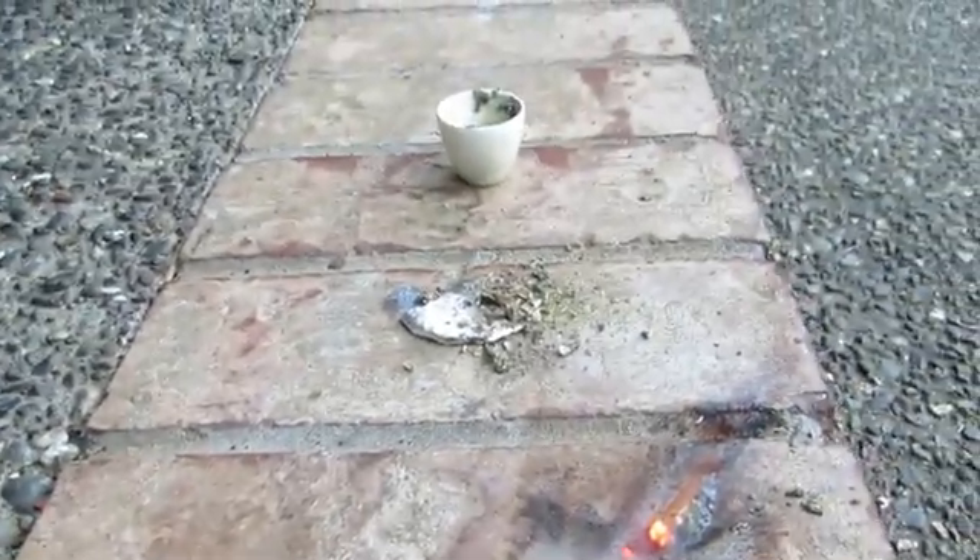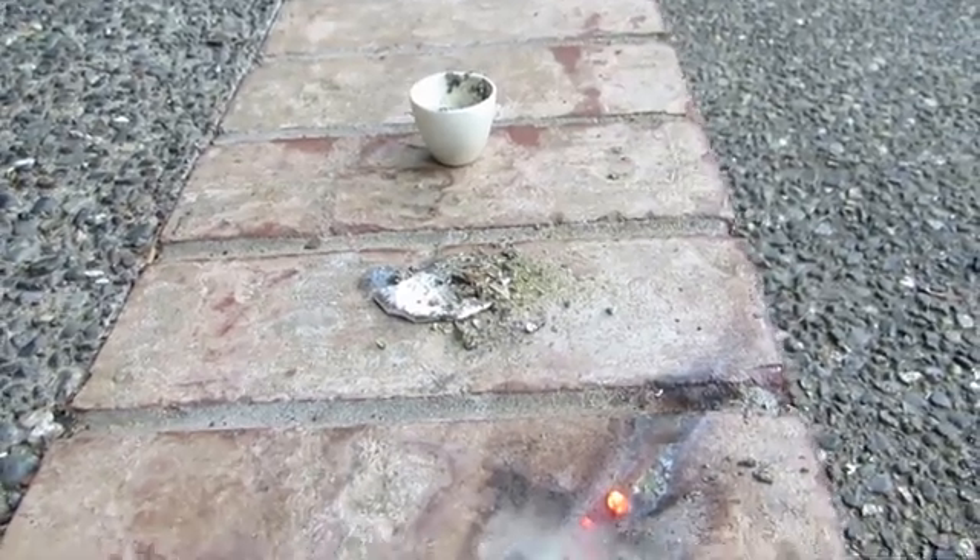I'm going to let this cool and perhaps re-melt it to get into a nicer bead. After I melted it a second time and formed it into this beautiful shape, you can see we have a beautiful sample of zinc here. You can see the beautiful shiny little bead of zinc. That is how to extract zinc metal from a carbon zinc battery, which you can get from almost anywhere. Dead ones work excellent also.